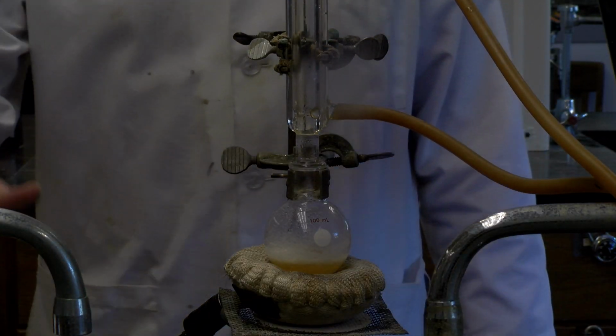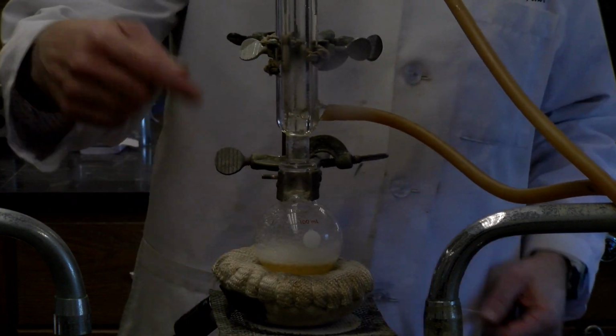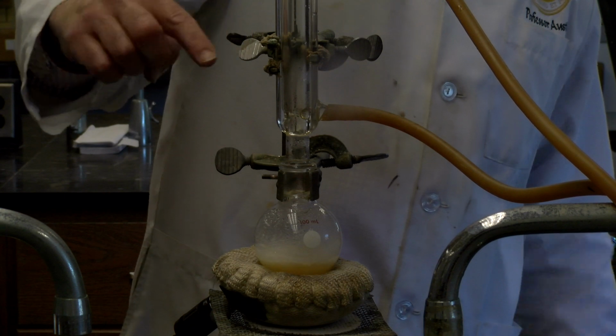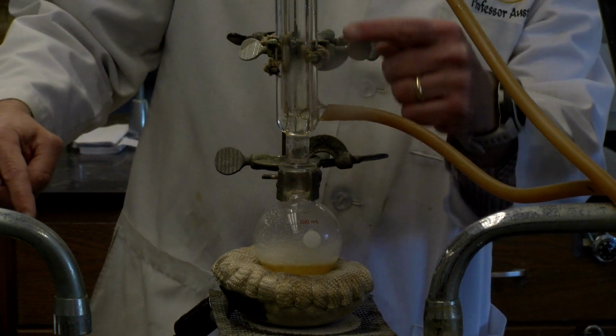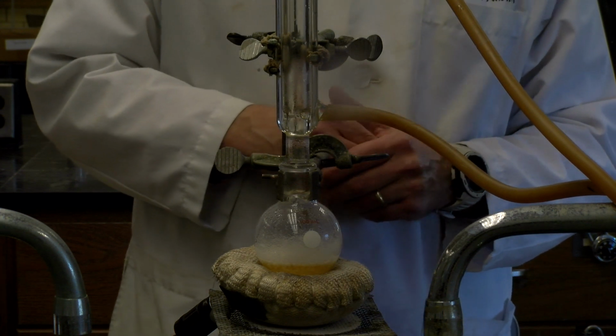So we've turned the heat down here. I've also lowered the heating mantle just a second. And you can notice that it's heating. So you might notice some condensation that's occurring here. And then you actually see a condensation ring that's occurring here. All right, and that's the reflux that's occurring that we talked about.